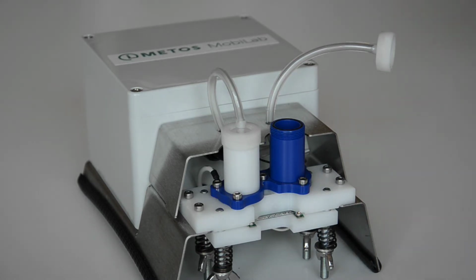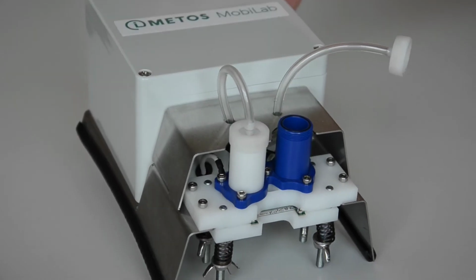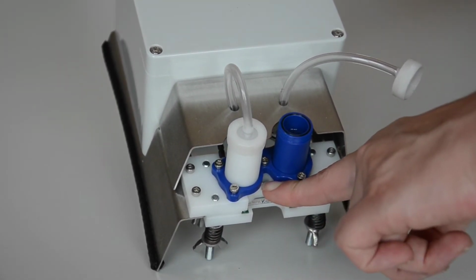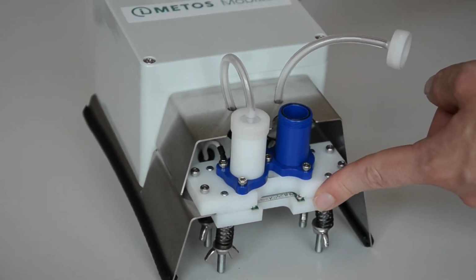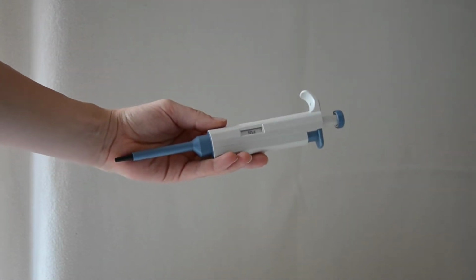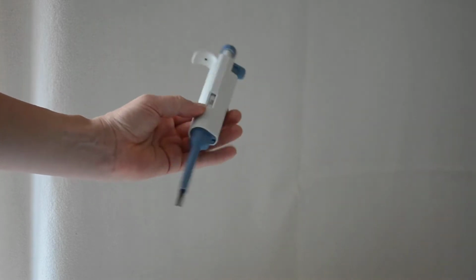This is the reason why we have to fill water into the sample hole now, because there is no sample in the sample hole yet. When we do this, we prevent the inlets from drying out. Do not leave any of the three inlets without liquid for more than half an hour while there is buffer solution in the chip. For this, we need to fill in water with the pipette.